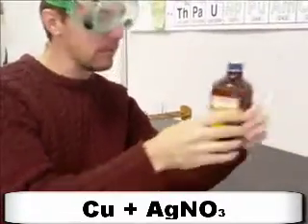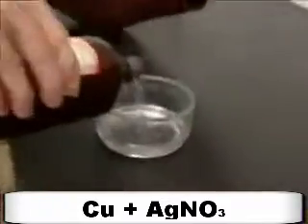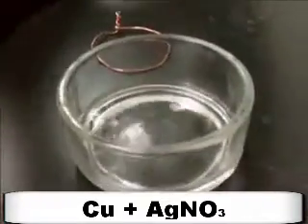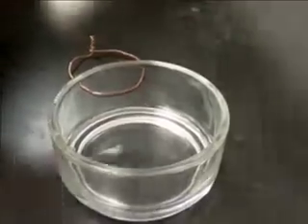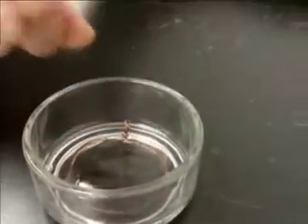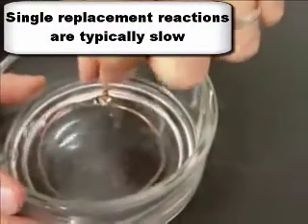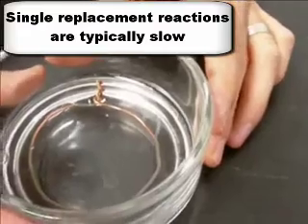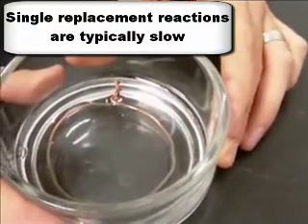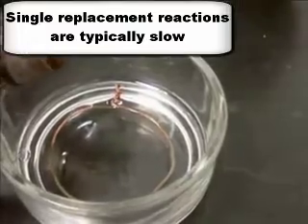All right, so we're just going to pour some of this into our little dish here. Just enough to cover the copper. Stuff's kind of expensive, so we don't put too much in. And we're going to put our copper in here. Now this one doesn't react instantly, but in a few minutes you'll see that some silver is forming on the outside of the copper. I'm actually going to add a little bit more just to cover it all up.